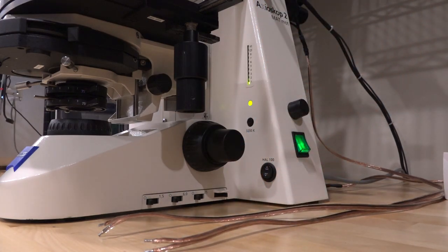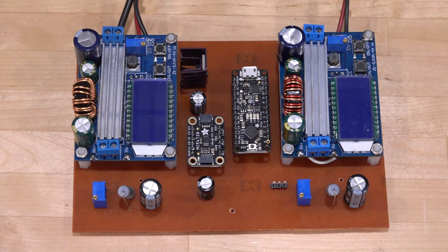Now, this is not a difficult thing to do. We can actually do it entirely in the analog domain. All you're doing is translating one voltage into another set of currents, and you can do that basically with op amps and transistors and so on. But I didn't want to spend so much time designing that, and I just wanted to get something done really quickly. So, of course, I went through the digital route. And here's what I came up with. It's a Frankenstein of components that I had lying around just to get the job done.